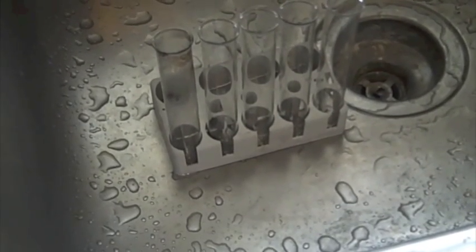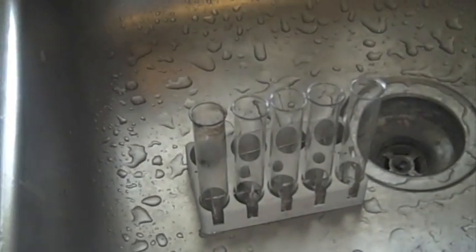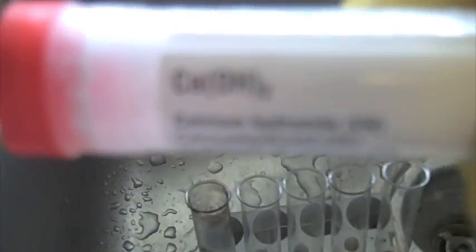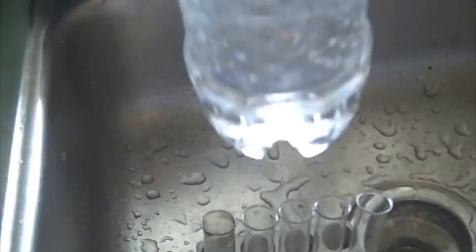Today I will be making a dilute solution of sodium hydroxide. For this you need some sodium carbonate and you need calcium hydroxide. Calcium hydroxide is corrosive so you should be very careful around it, and sodium hydroxide is corrosive. You also need water.